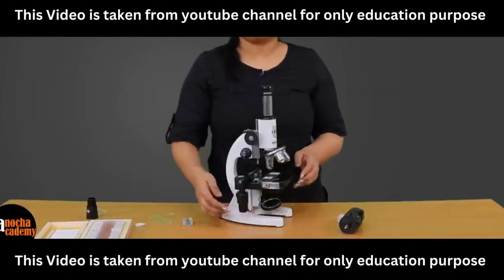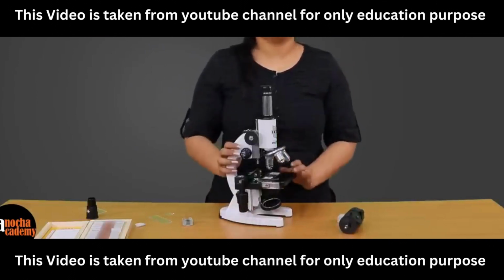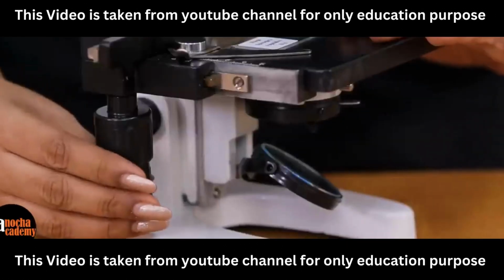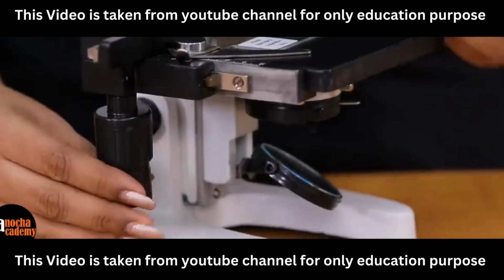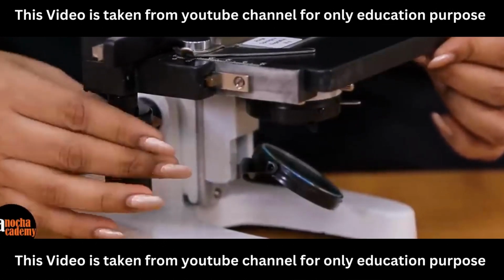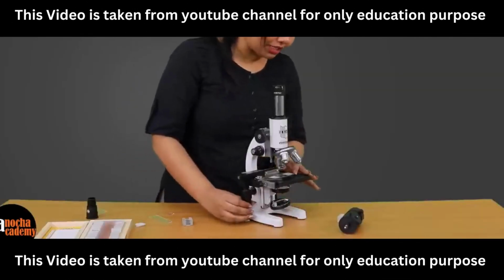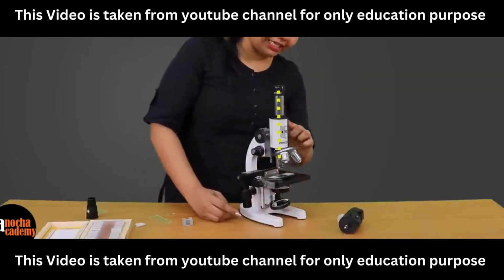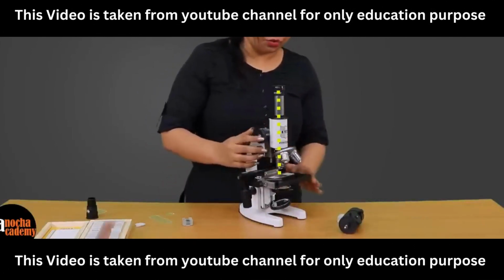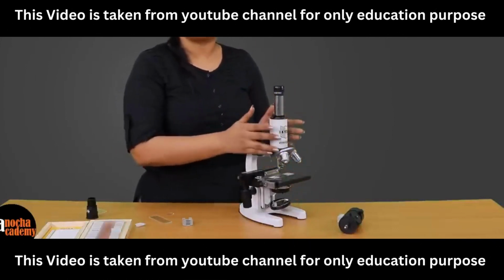Certain compound microscopes may not have this screw. In that case, you have to manually move the slide. However, if you are provided with these screws, as you can see, we can move the screws and move the slides right and left, backwards or forward. Now once we have brought the slide and the specimen right in the same line as the lenses, we can start using the coarse adjustment screw to focus.